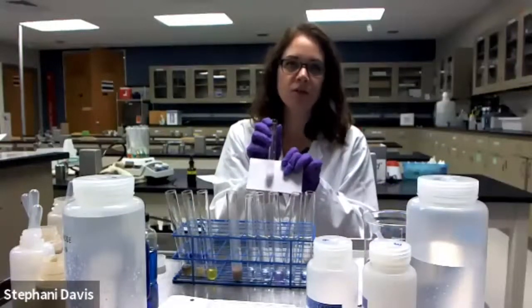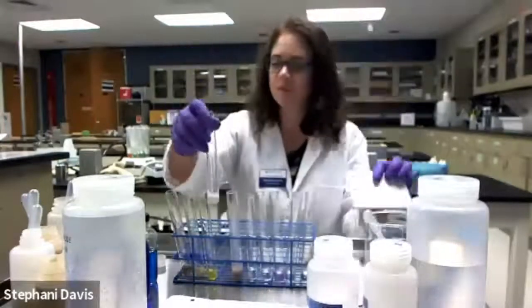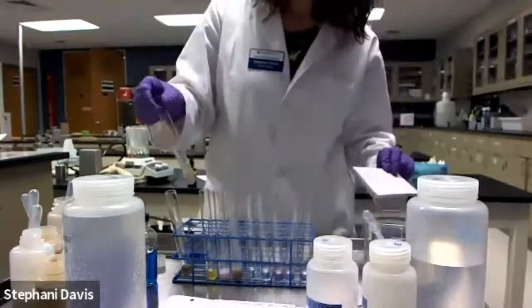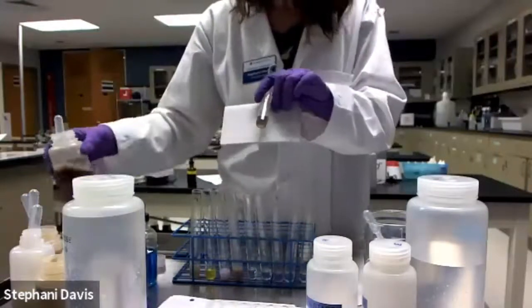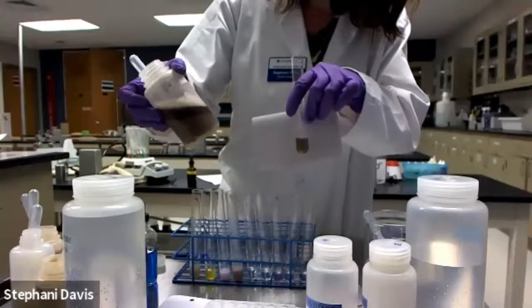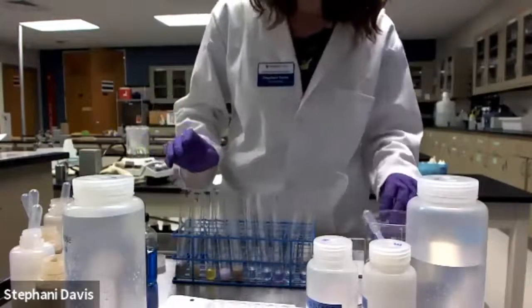All right, number 7, that's our milk. What do you think, positive or negative? Next we have onion. Number 9 is banana. So I'm not seeing much of a color change there. All right, next we have the potato. This one's a little bit difficult to tell because it almost looks slightly purplish. It's like a murky brown. Doesn't appear to look much different from the stock solution.